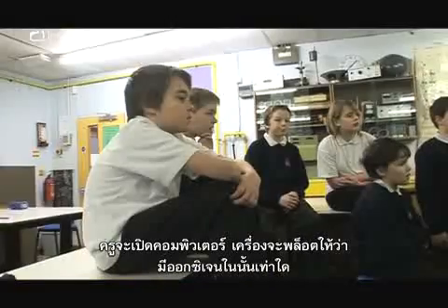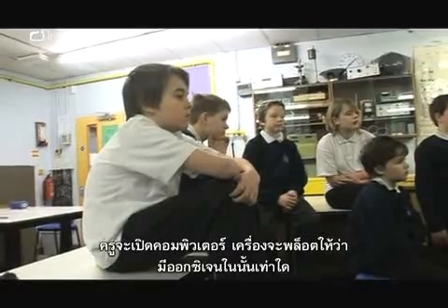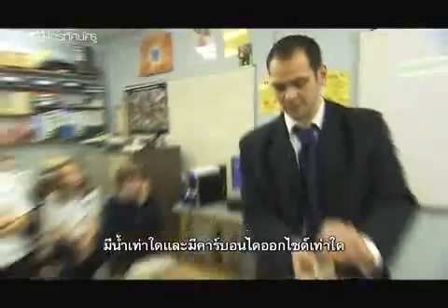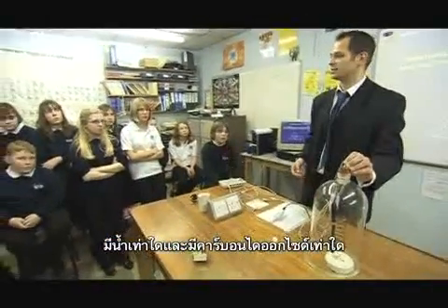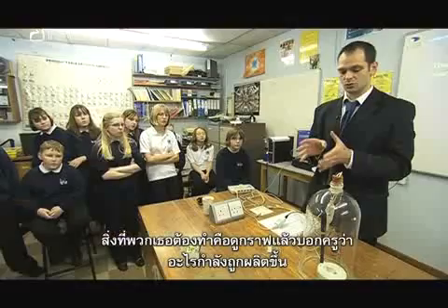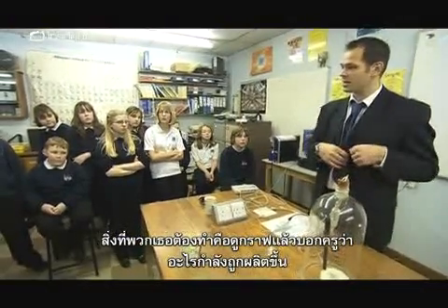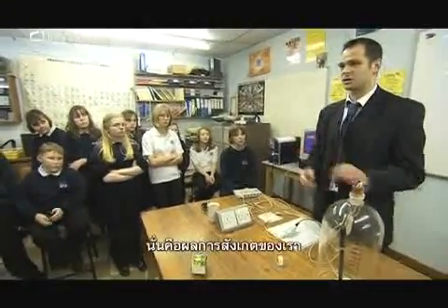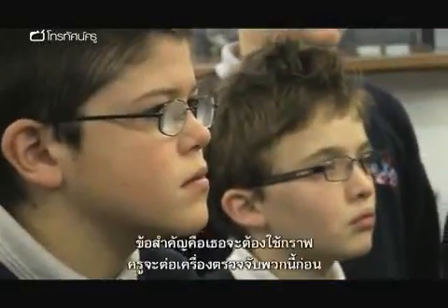I'm going to turn the computer on, and the computer is going to plot for me how much oxygen is in there, how much water is in there, and how much carbon dioxide is in there. And you're going to have to use the graphs to tell me which one is being produced, which one is being used up, and those type of ideas. Okay? So you've got to use the graphs.